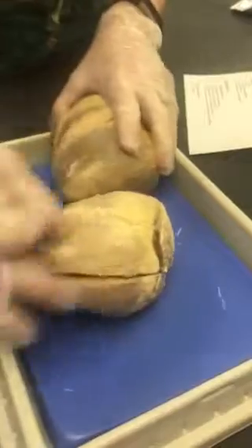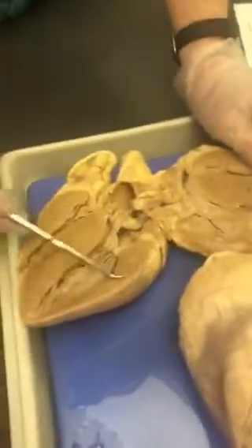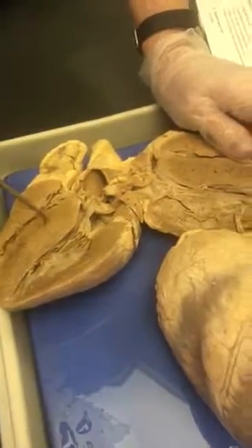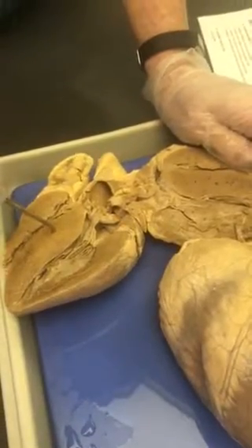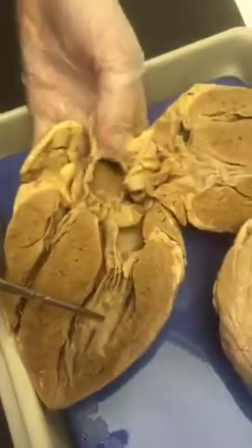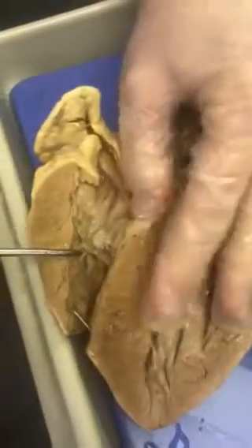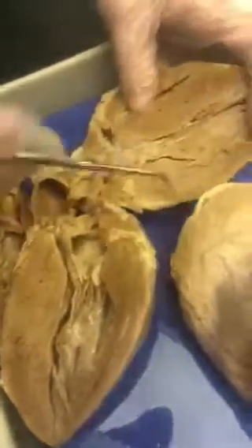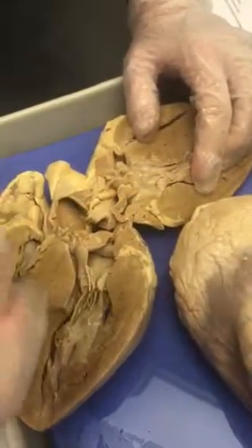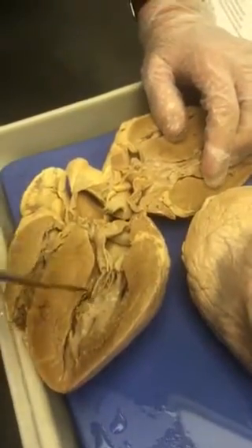All right, then on the inside of the heart, let's do the muscles first. All right, so the walls of the ventricles are myocardium. If I say name the muscle, that's what you're going to write, myocardium. If I put a pin in this bulging muscle inside the ventricle, let's see if we can find one in this right ventricle too. Not a very good one there. Well, that's the best one. But the papillary muscles are going to be attached to the chordae tendineae. All right, so that's papillary muscle.